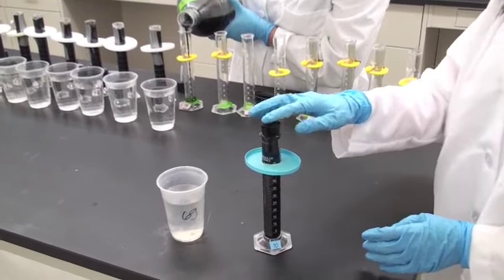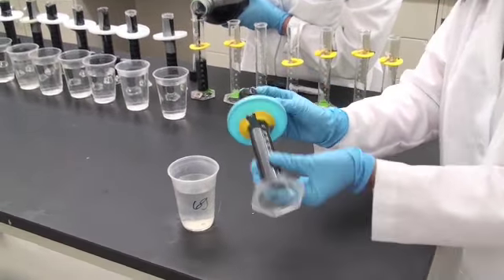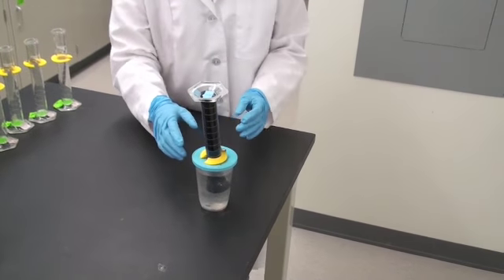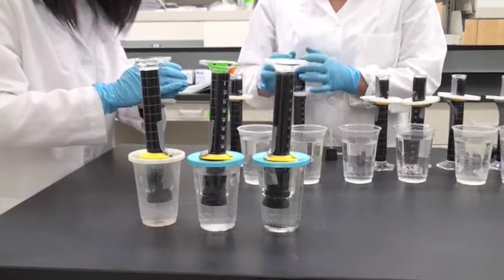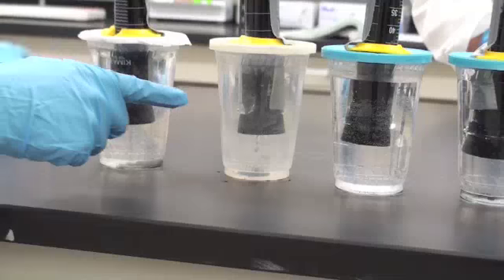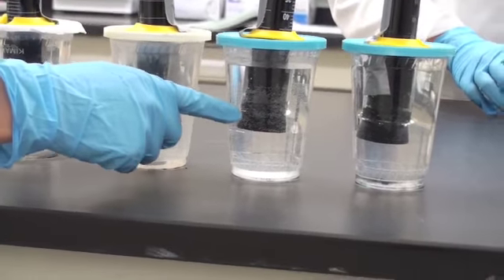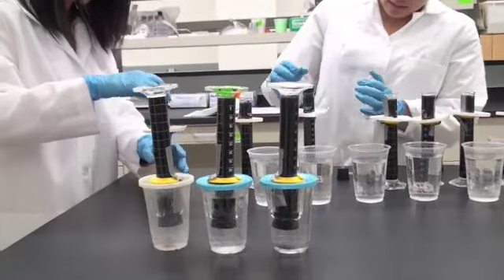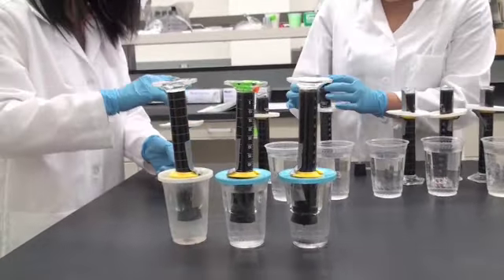Covering the hole in the stopper, the graduated cylinder is placed upside down in a cup of water. The support ring ensures that the tops of the graduated cylinders, now flipped upside down, will remain uniformly submerged in water, with the plastic rim preventing the cylinder from being too far submerged and from resting on the opening of the stopper. The samples are placed in the desired temperature control room or incubator.